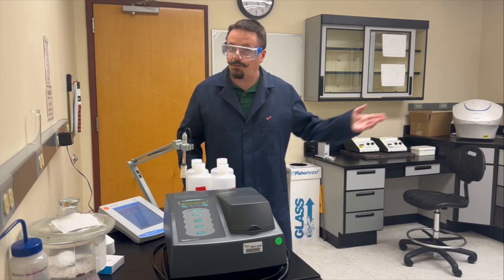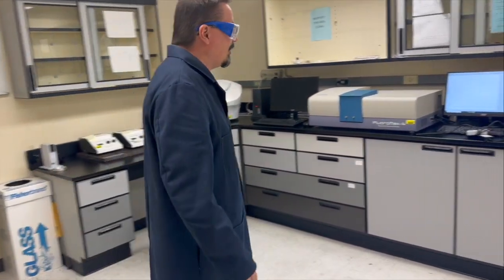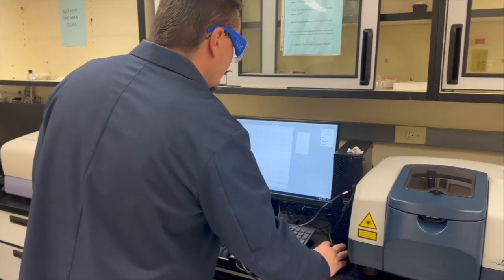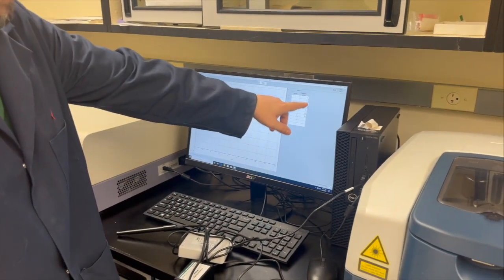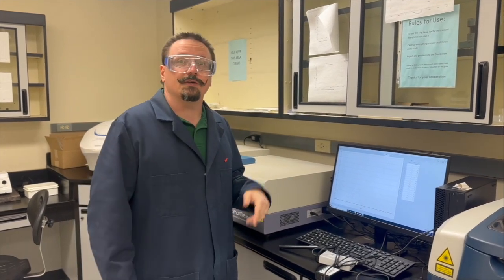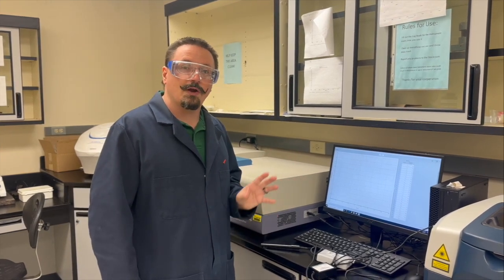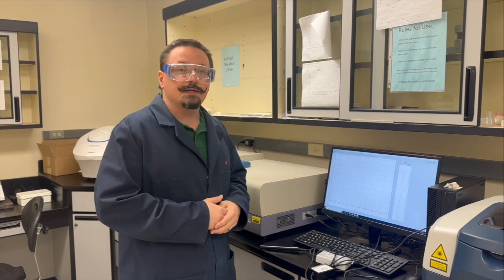The last portion — technically the third thing in your instructions — is the determination of dissolved solids, and you can do this last or third. For this, you'll use the conductivity probe, which will be set up in this room on this computer. Hit collect when you're ready and run through the algorithm. We'll have a concentrated solution of sodium chloride for you — a concentrated stock — and you'll make a series of dilutions from that. Spike your water sample, then measure with the conductivity probe. That's for the standard addition plot. Make sure you're extra aware of how standard addition plots work — you have a pre-lab question that deals with that, and similar to the pre-lab question is how you're going to work up this data.